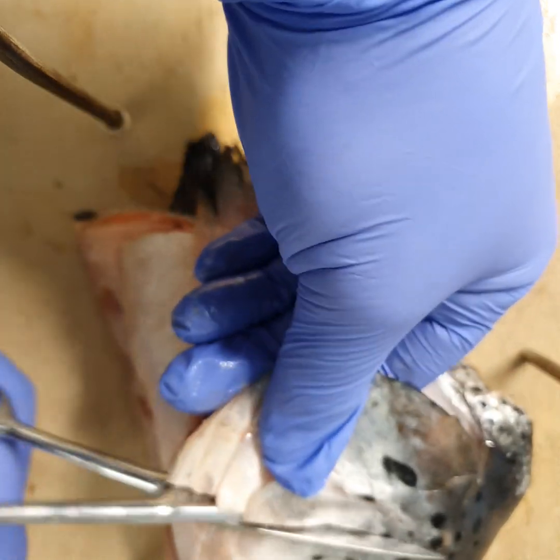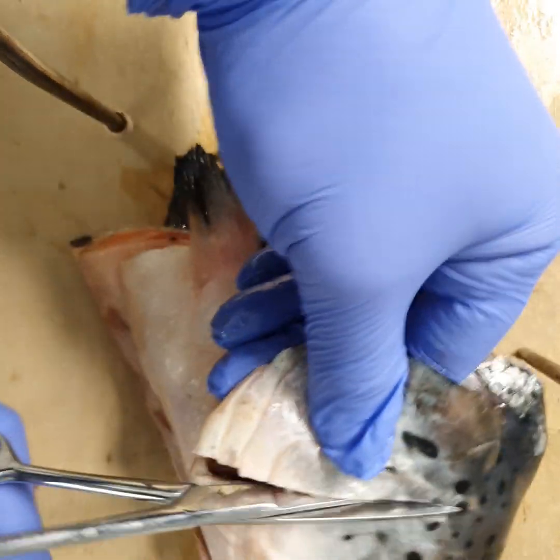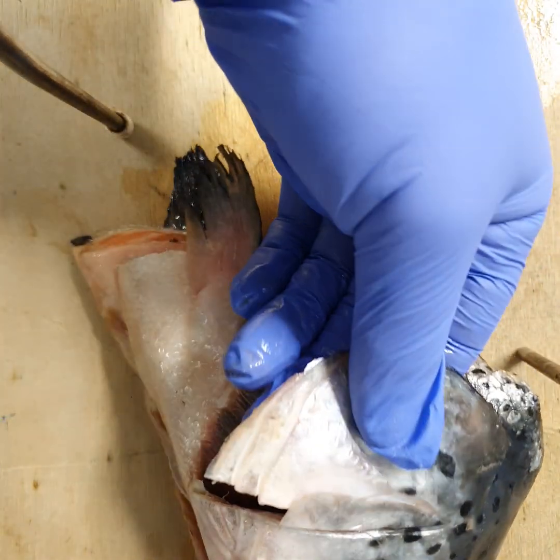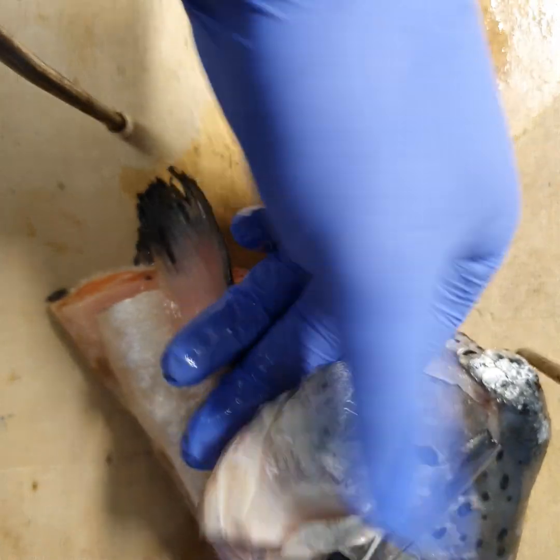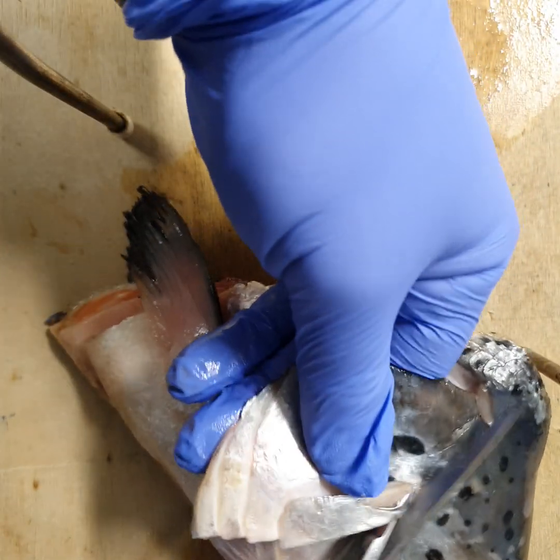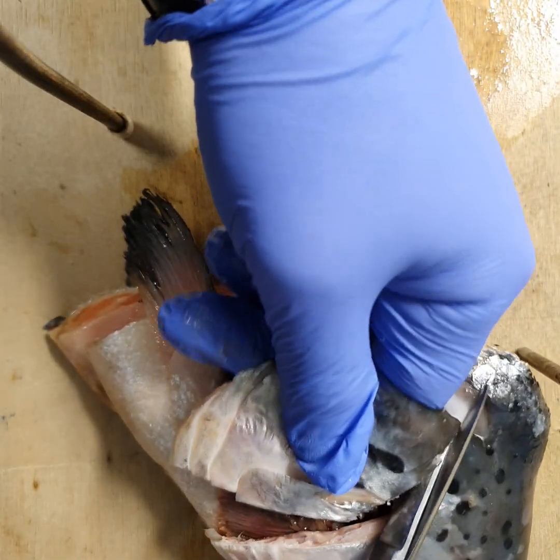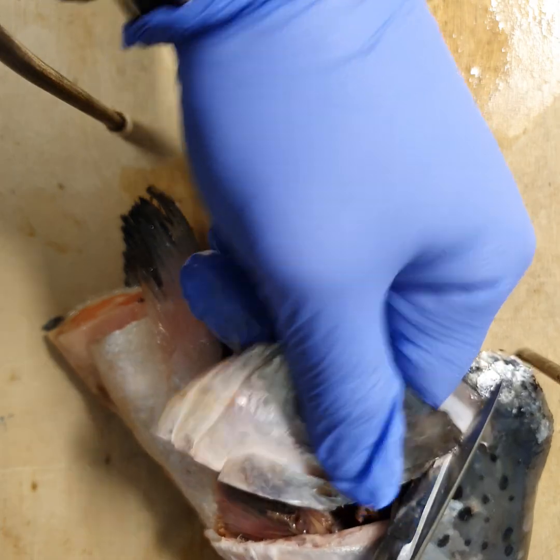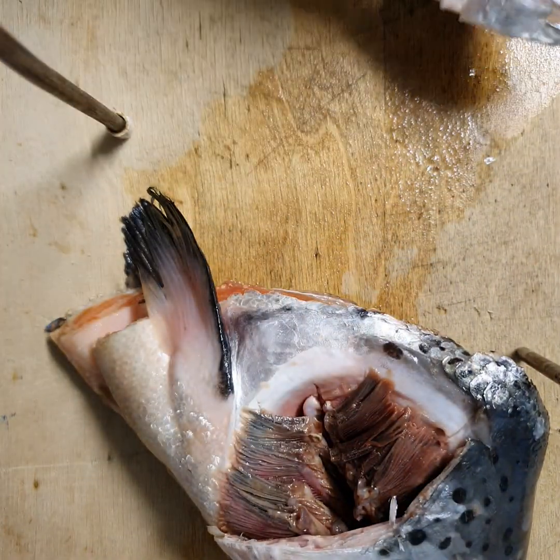It is quite difficult to cut. One of the key functions of the operculum is to protect the gills, so it makes sense that it's hard like this.